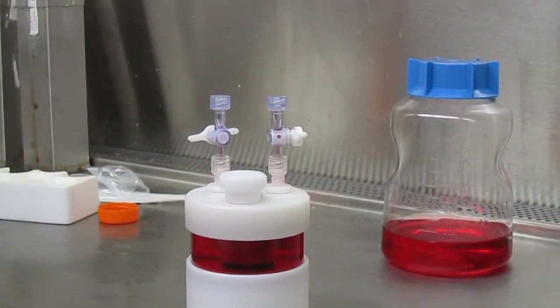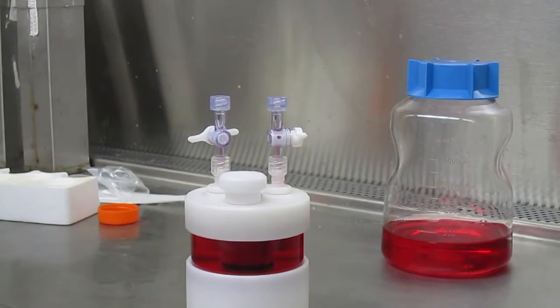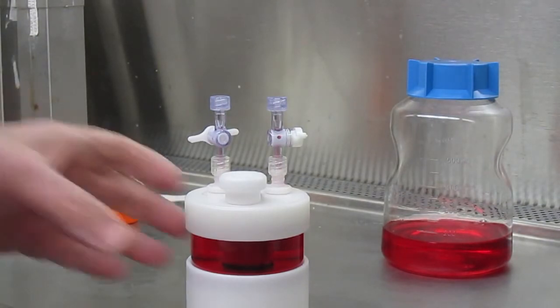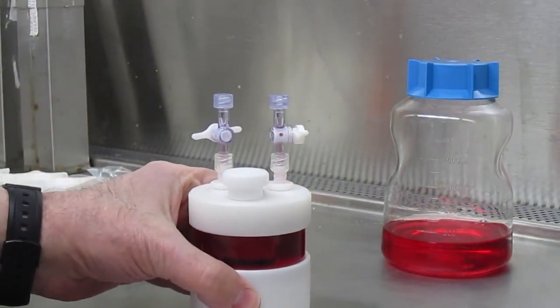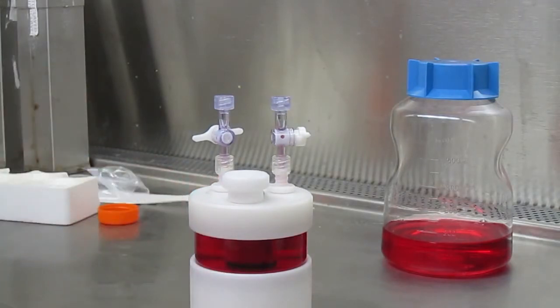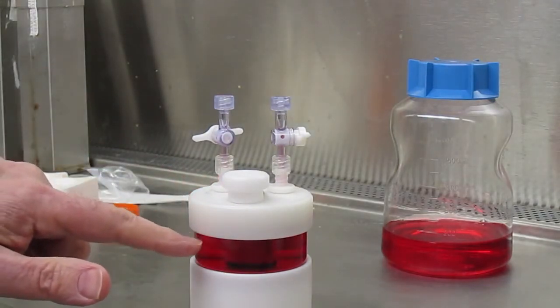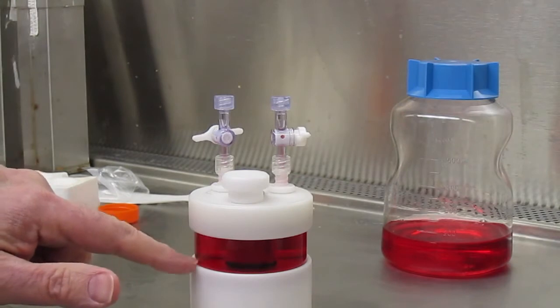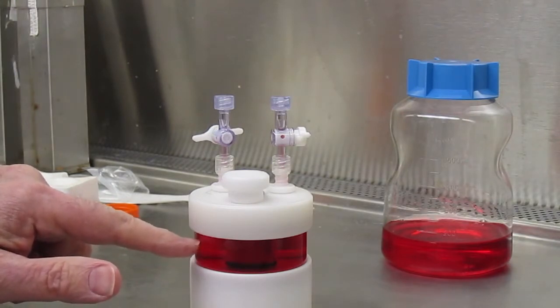To change the media, the vessel is taken back to the hood and allowed to stand as shown until the cells in the media settle to the bottom. This may take three to five minutes.